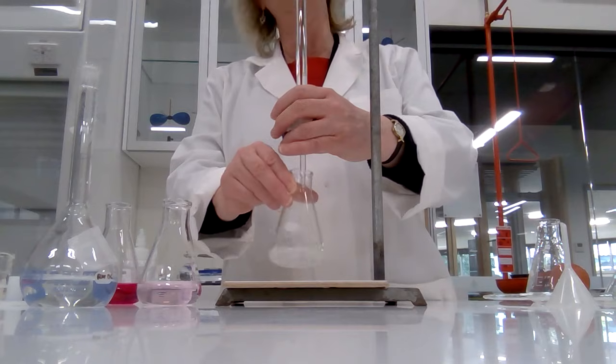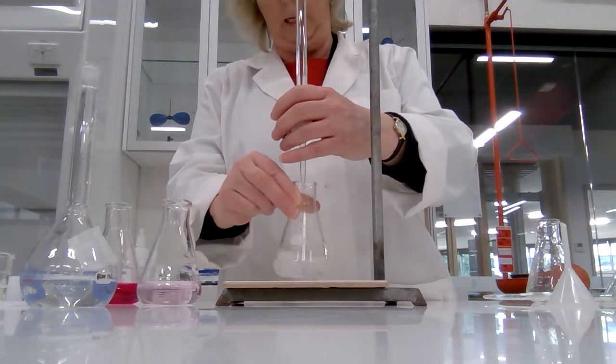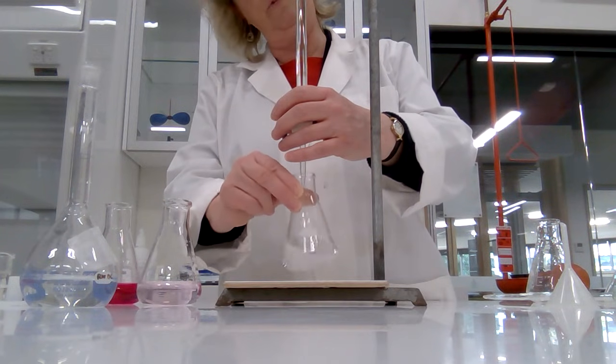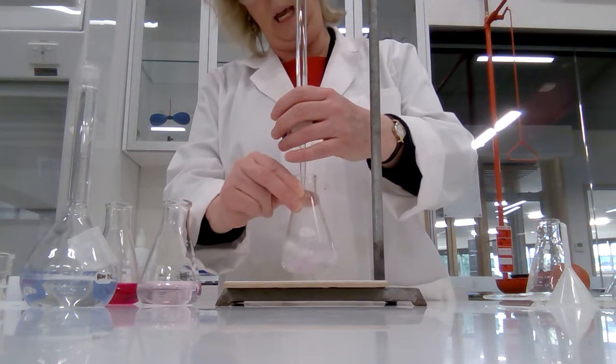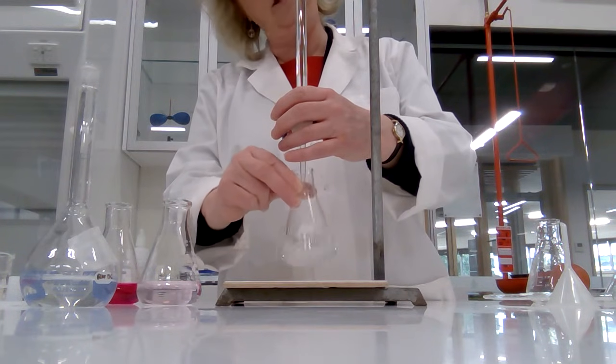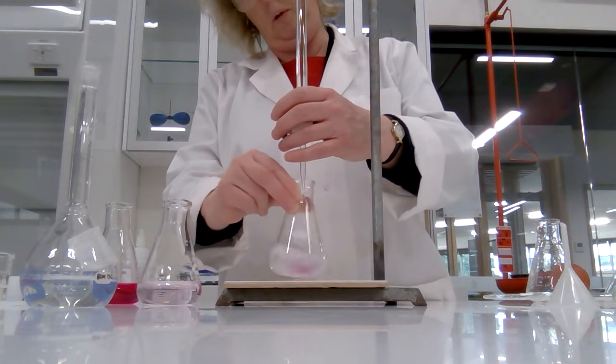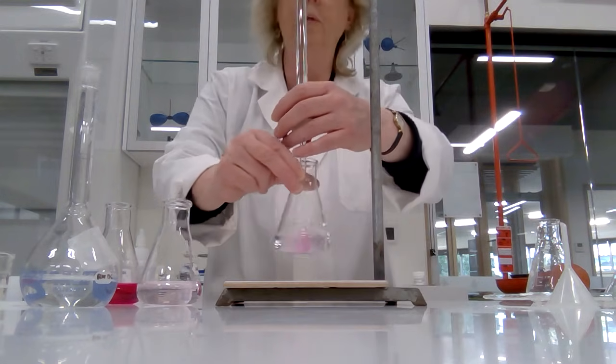It really seems as though I've rigged it if it's coming out to 20.00, but I promise you I have not rigged it. So I'm going down. I'm hoping to go down to 41.30. However, I will be very careful and I'll just watch the color as I get close to the end. I won't read the burette and cheat. So getting close, getting down towards 41.